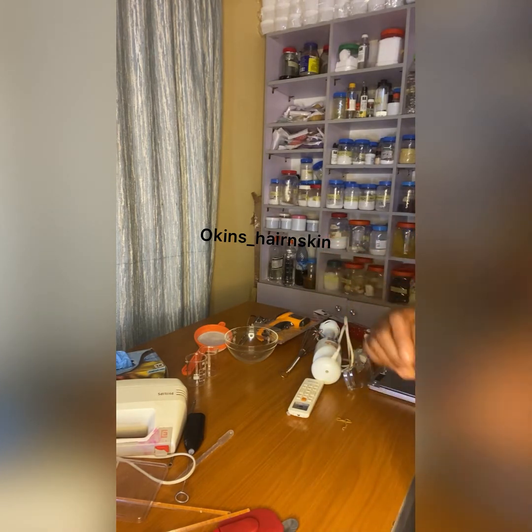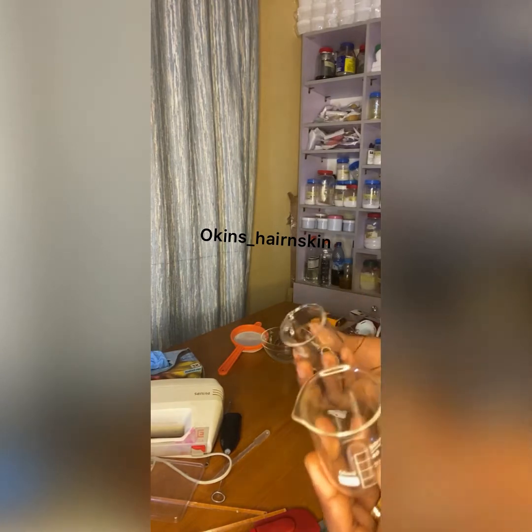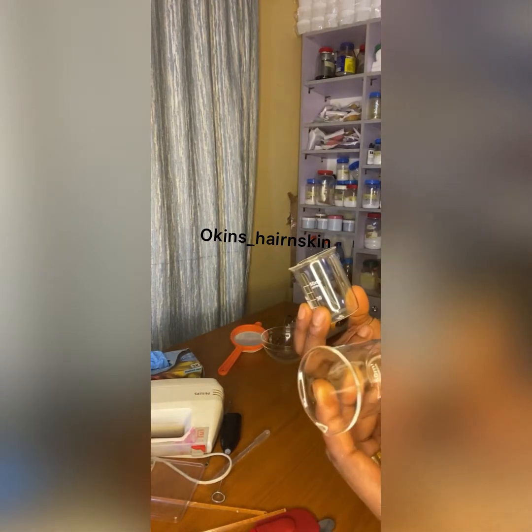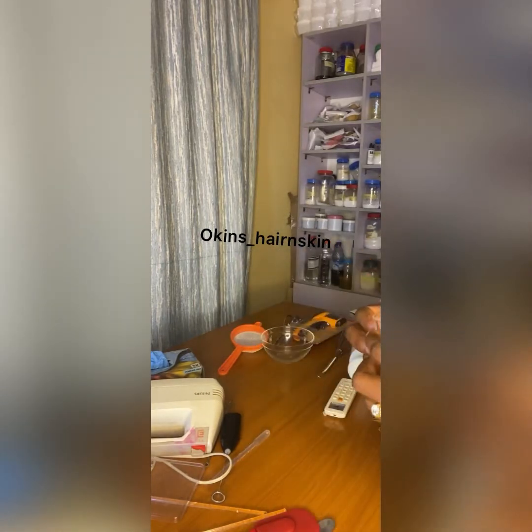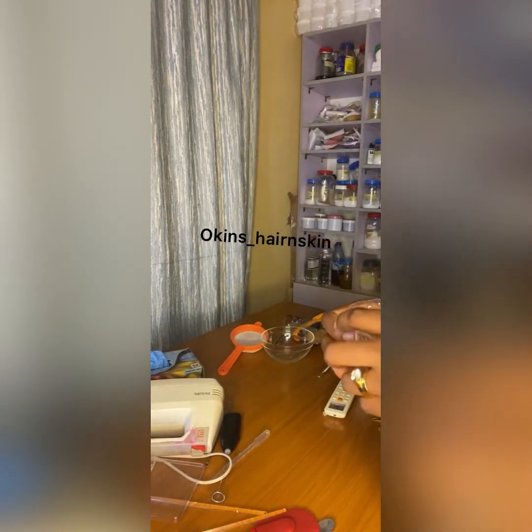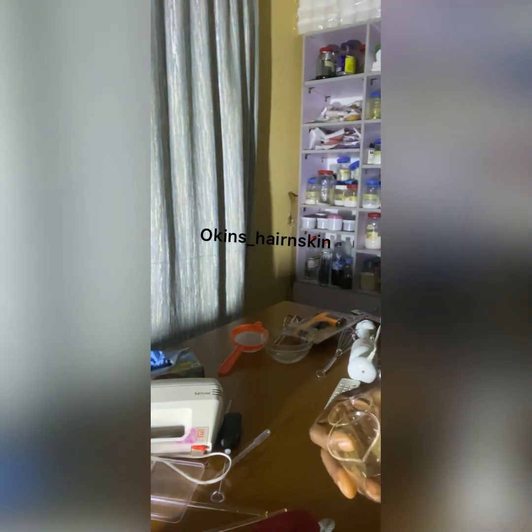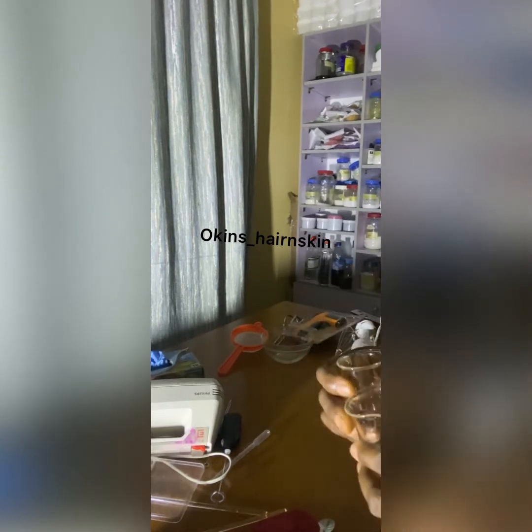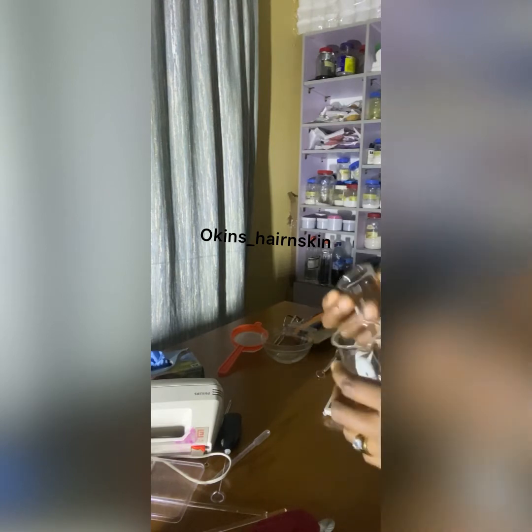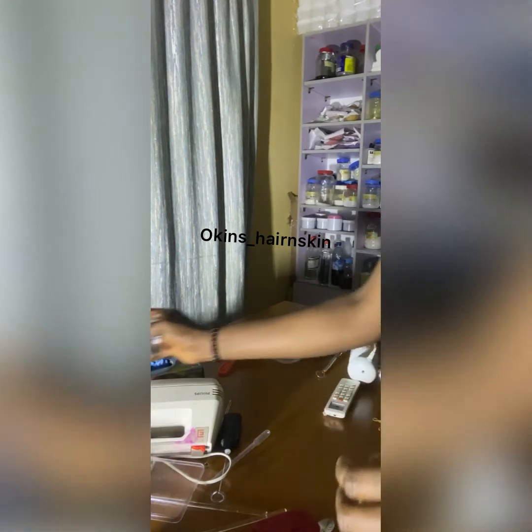So another thing you need as a young formulator is your beakers. So you see, this is 50 ml. Like I said before, if you are a new formulator, 50 and 100 ml is what you should start from. So you should not formulate any product that is more than 50 or 100. So that's that.